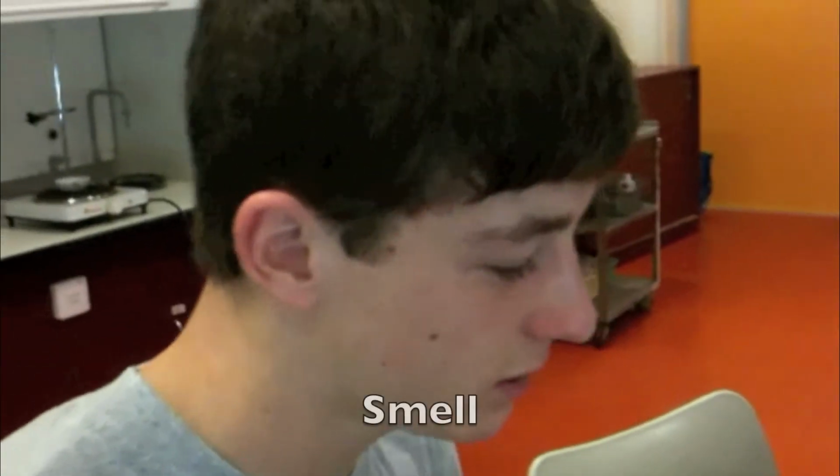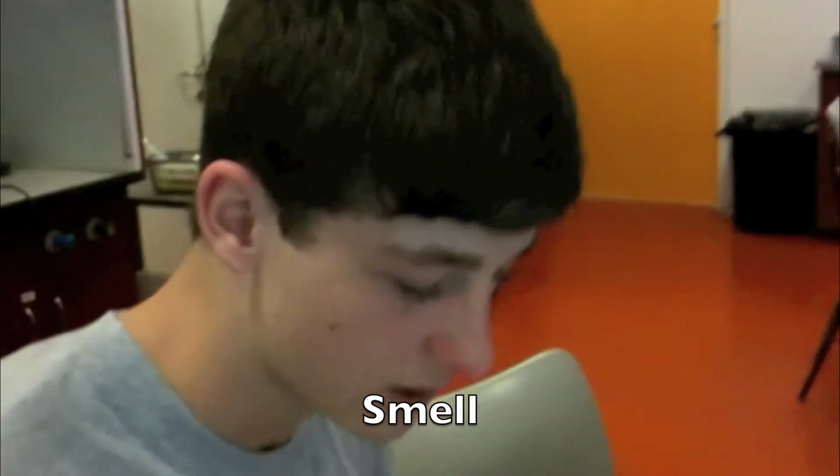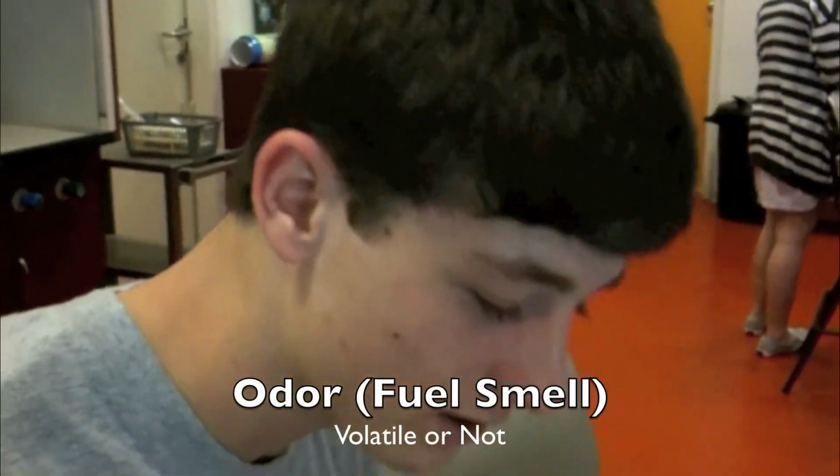Okay, now we have to smell each one of the elements and see if it has an odor. If it does, then it's volatile, and if it doesn't, it's non-volatile.